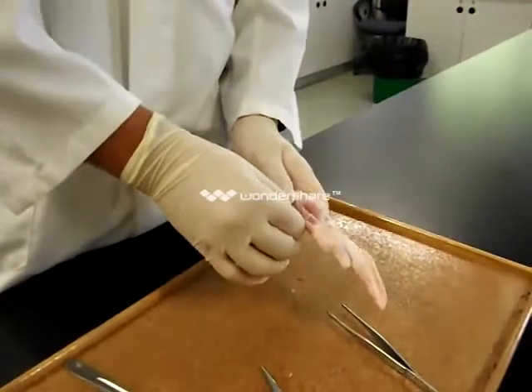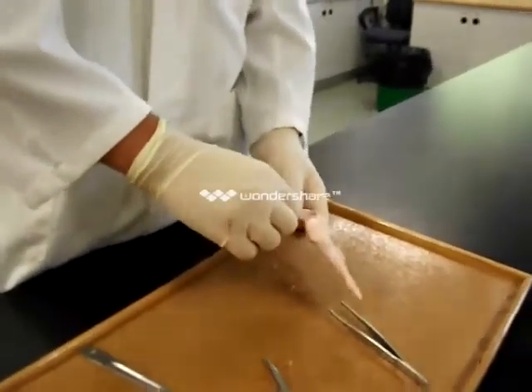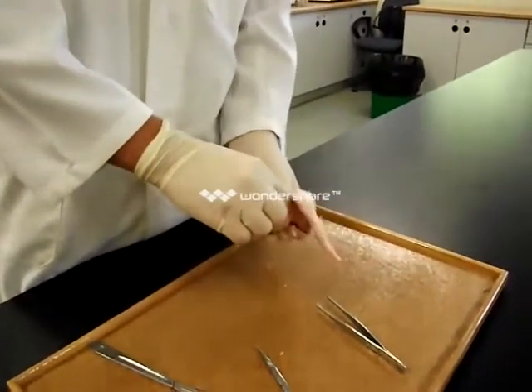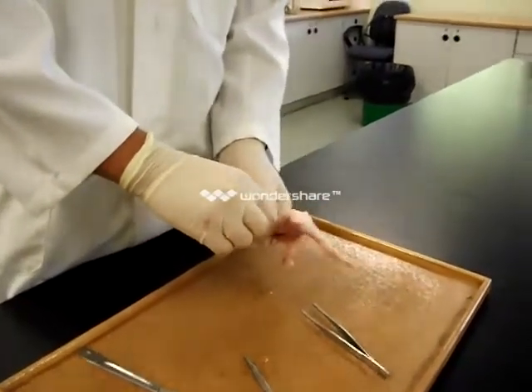That's a small movement at the end, but we can make a larger movement when we contract a larger muscle. Oh there it is! Very good! Contraction and a response, contraction and a response.